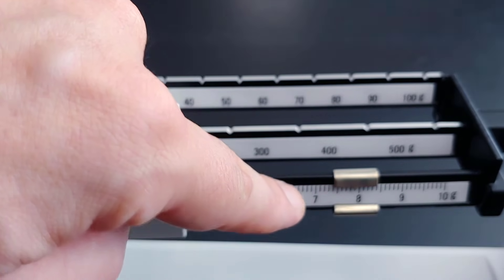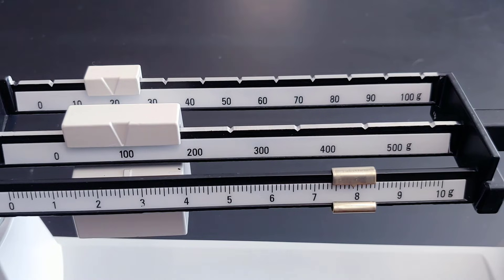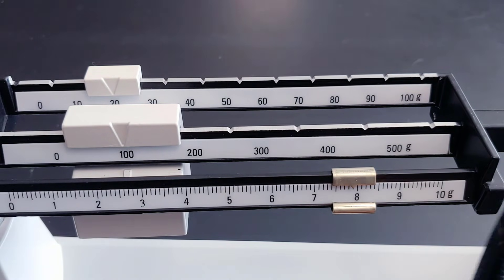And this one's after the seven, so that'll be 127 point something. We have to count the number of dashes over it is.